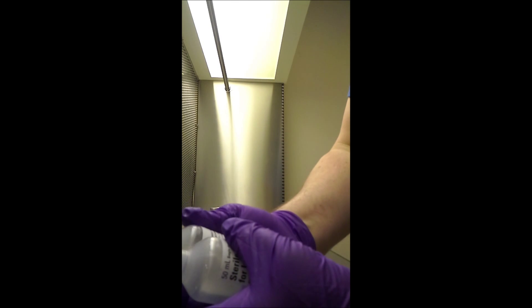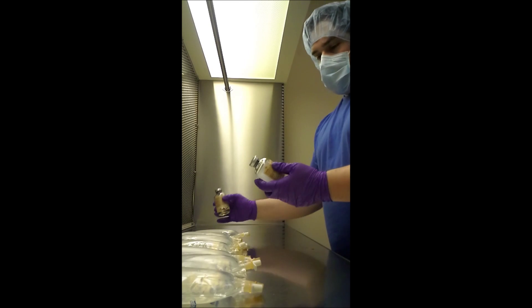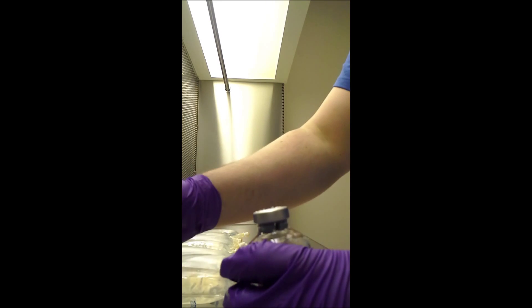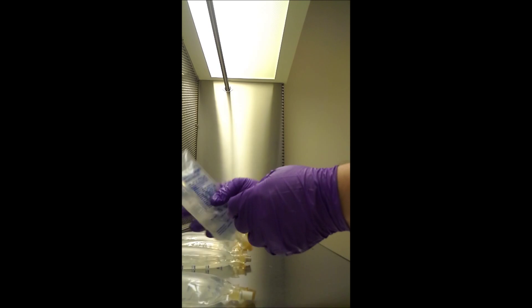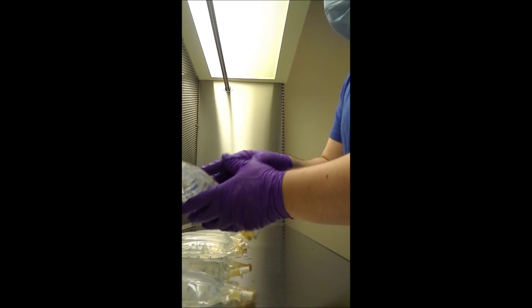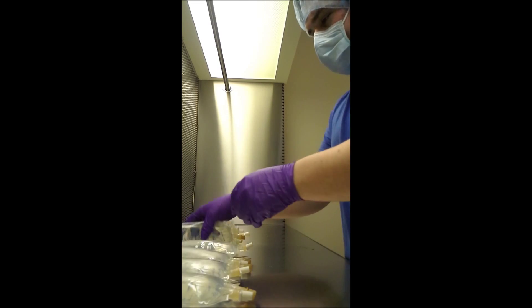I'll take a look at these. These both have the same lot number, so I can throw one in the sharps container. These here also have the same lot number — I can throw one in the sharps container, so that way everything is recorded. Now I just go through and move them around. That's the process.